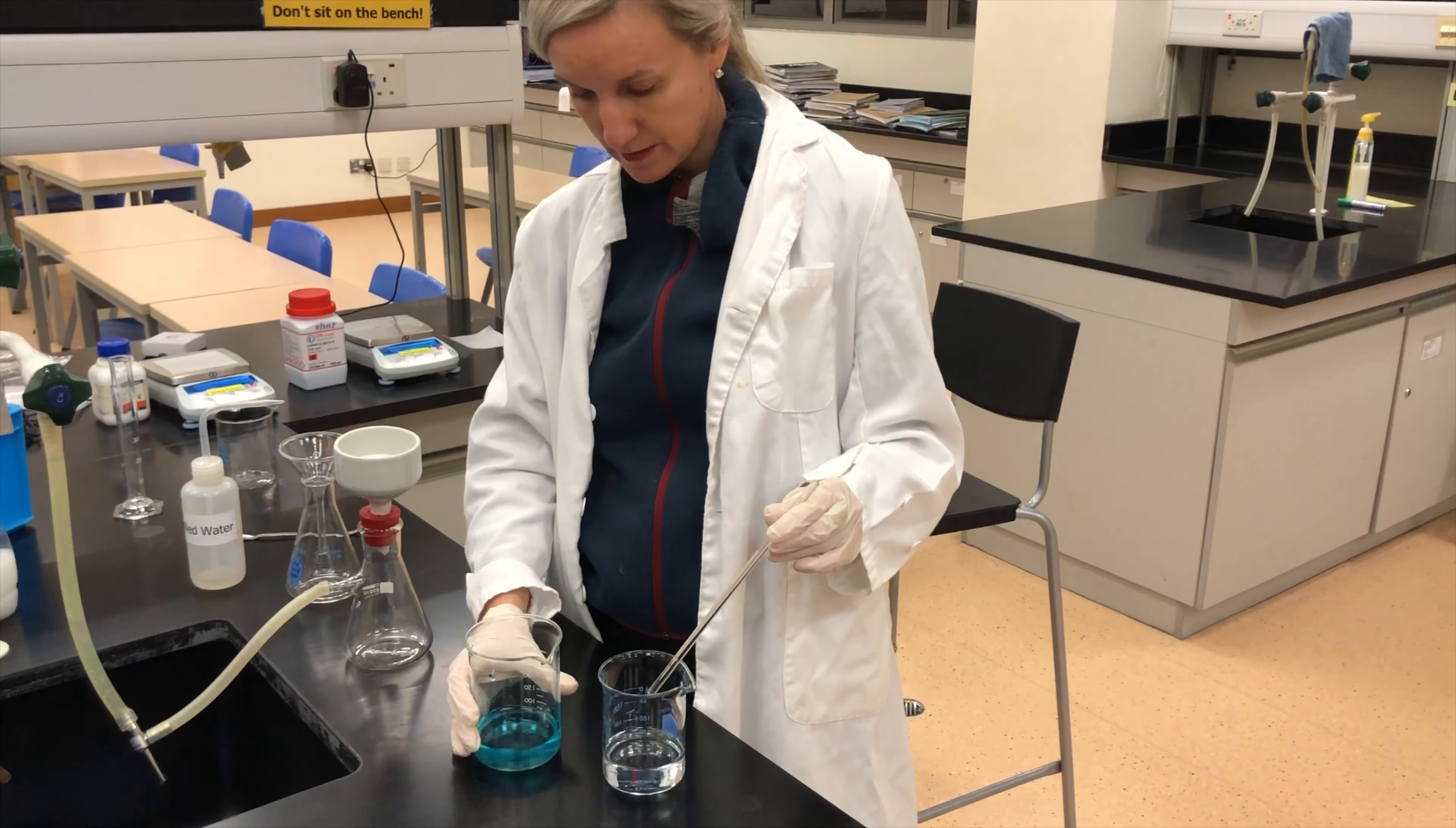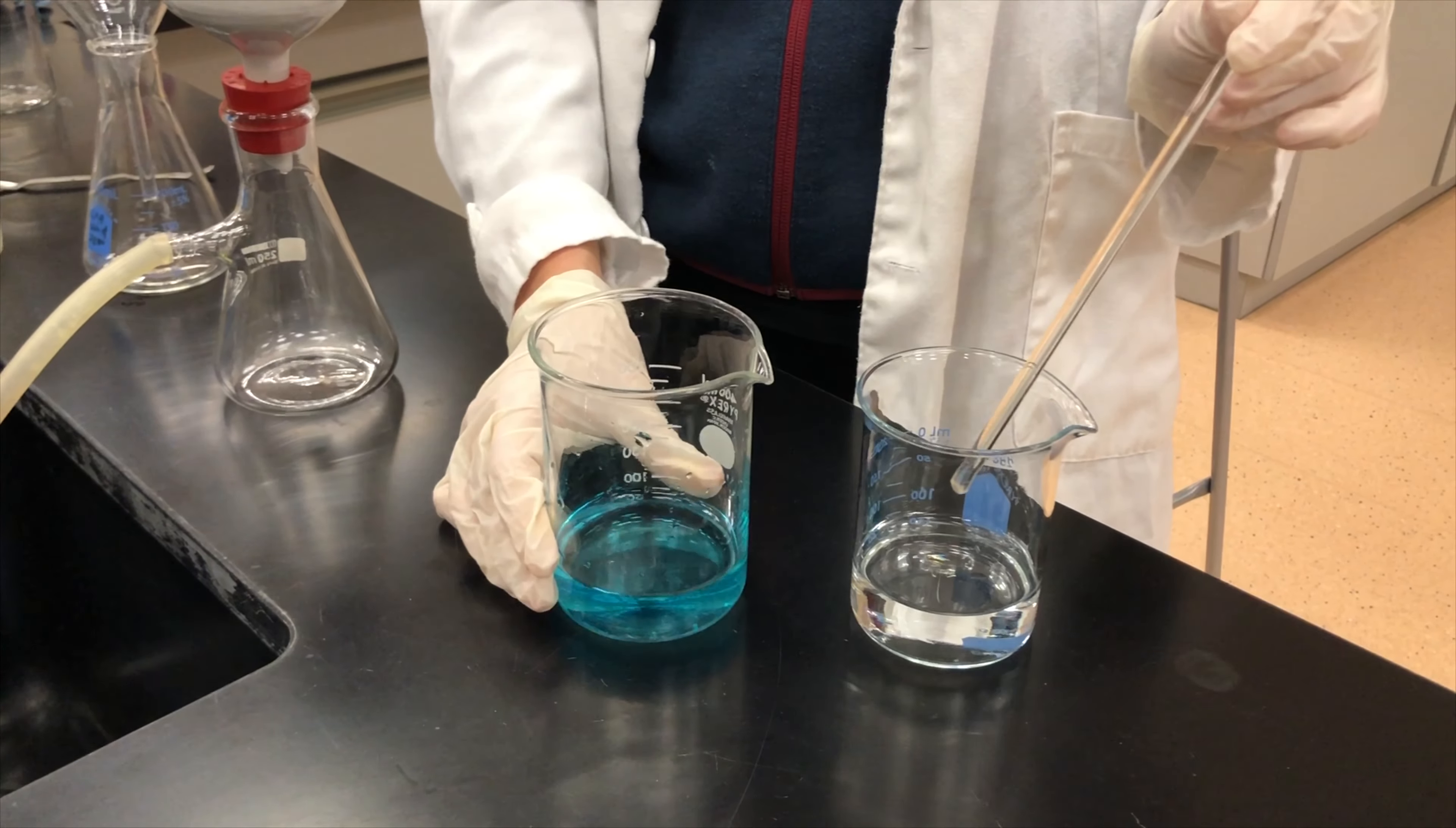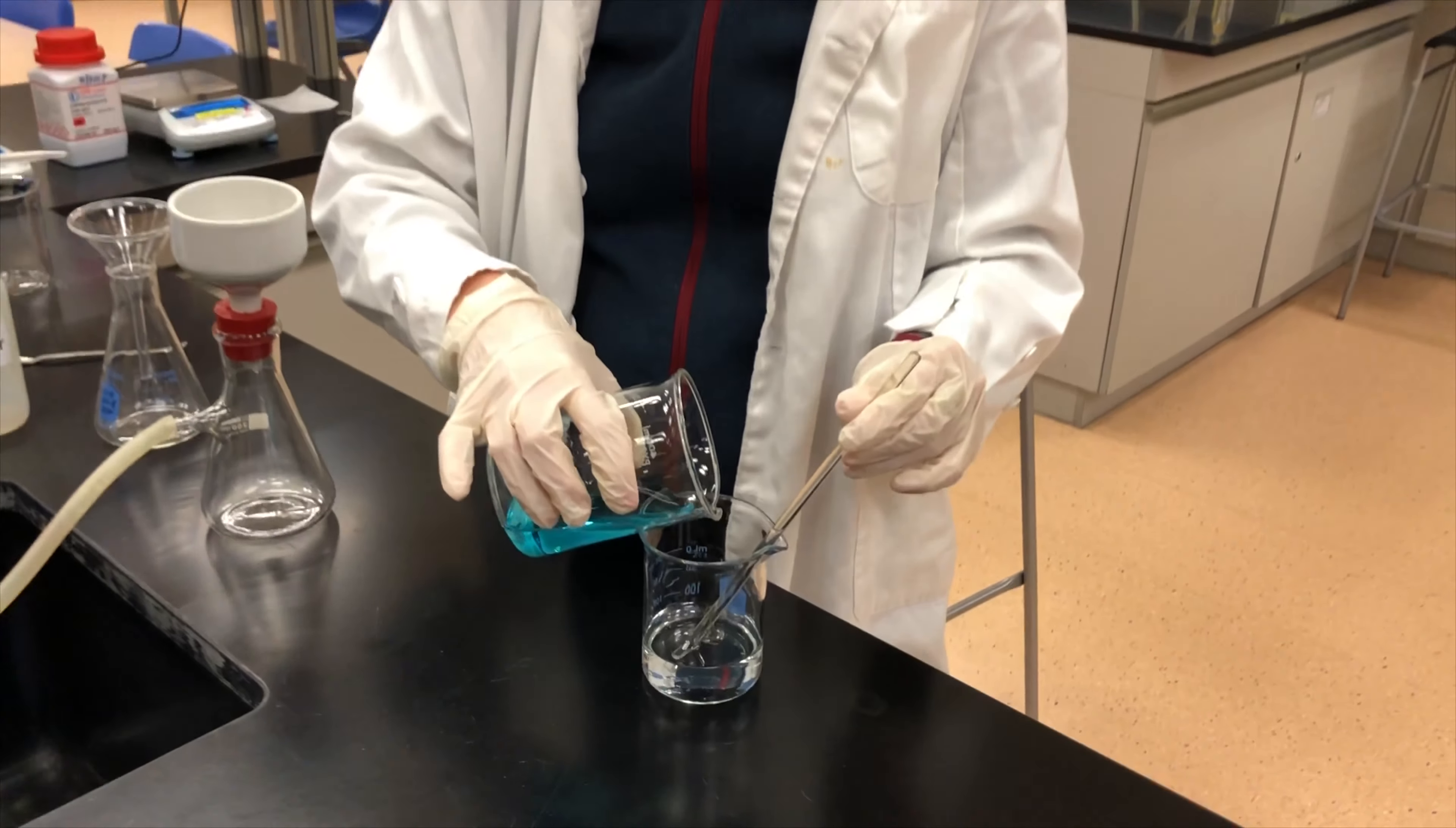Okay, so you can actually see I've mixed my two solutions, the strontium nitrate here and my copper sulfate solution here. And what I'm actually going to do is join them together, and we should see a precipitate being formed.